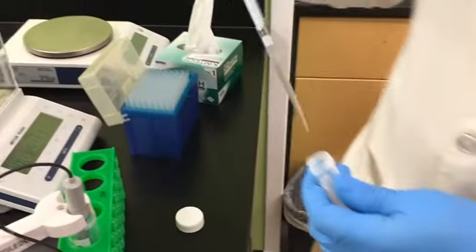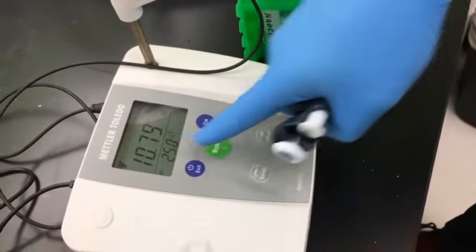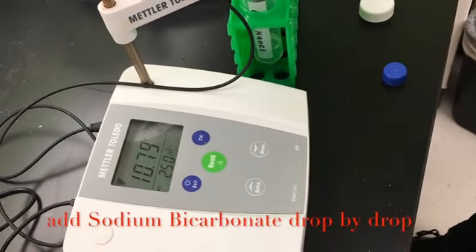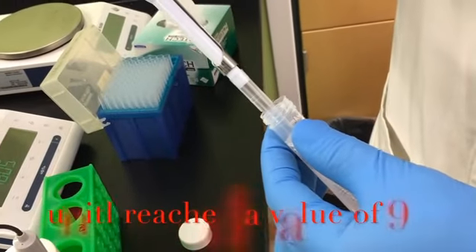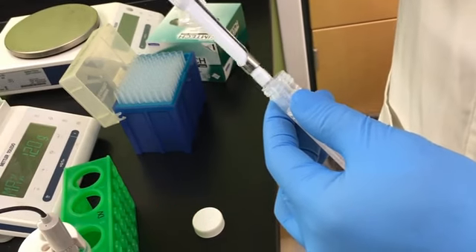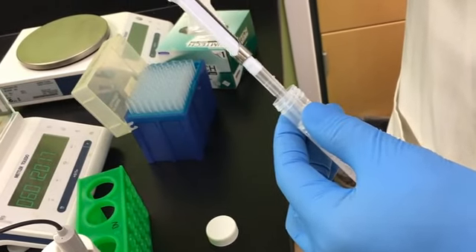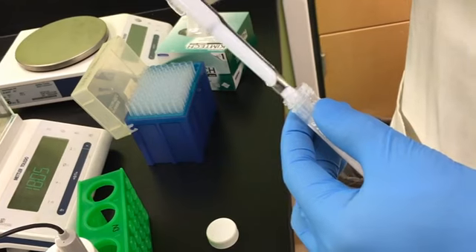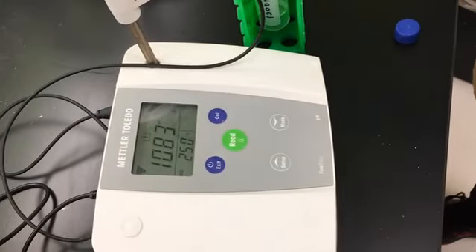Now we try to adjust the pH of 0.5% sodium hypochlorite. The final pH of the unbuffered sodium hypochlorite is almost 10.8. So we're going to use sodium bicarbonate to adjust that pH and drop it down to pH 9. We're making sure that our sodium bicarbonate is completely homogenized. And before we add, we're going to do a read so we can watch our pH live.